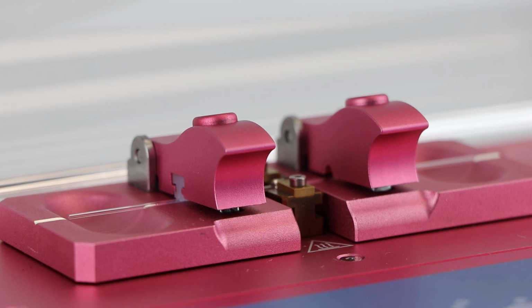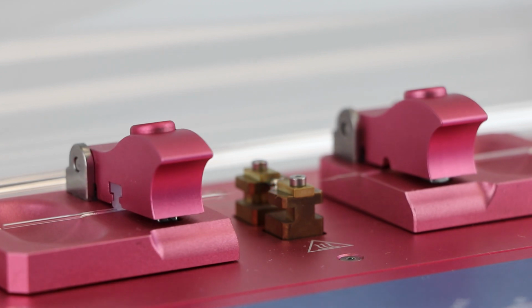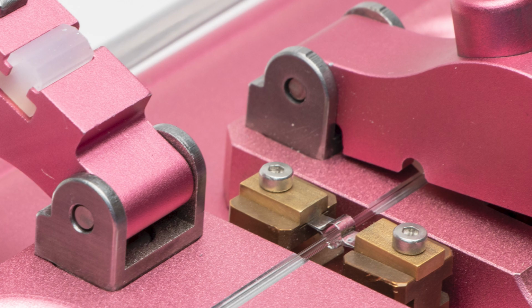Third, heat radiating from the filament plays the most important role in the glass's transition. The distance between the surface of the glass and the surface of the filament affects the amount of heat transferred. So it's critical that the glass is placed at the very center of the filament so that all faces of the glass are evenly heated.